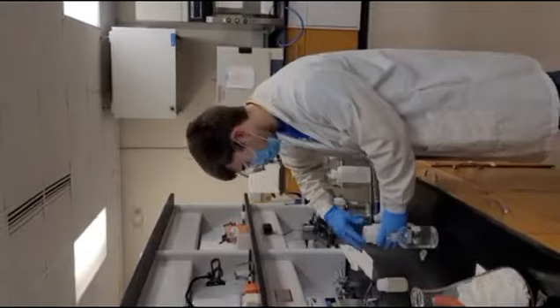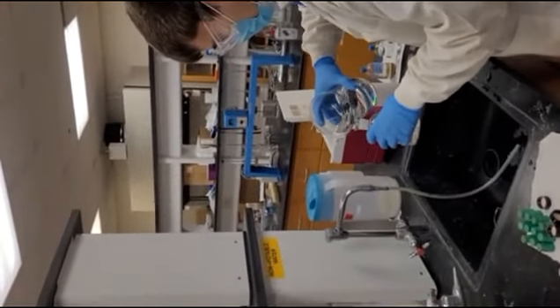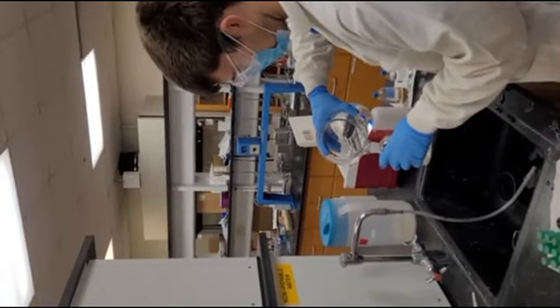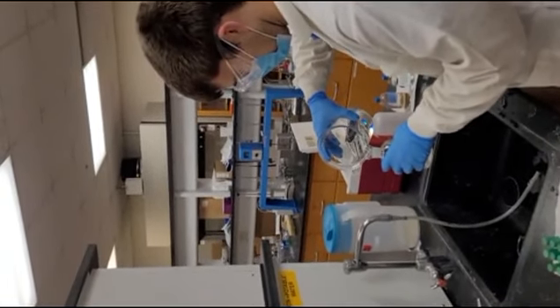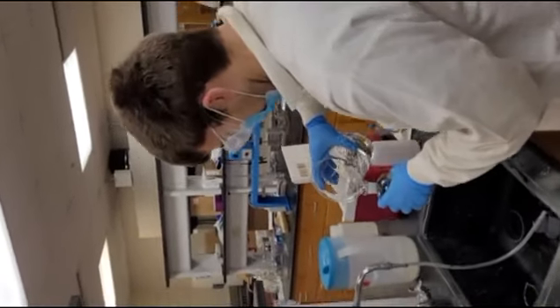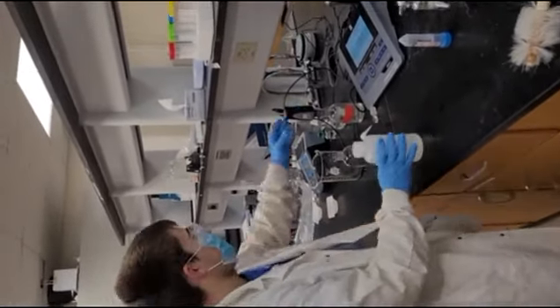Now again, we will dilute the rest of the way with nutrient water, which you should remember from class and lab lecture has different nutrients to help cultivate bacteria for the test. Again, fill it up, no air gap, lid again. Take your reading.